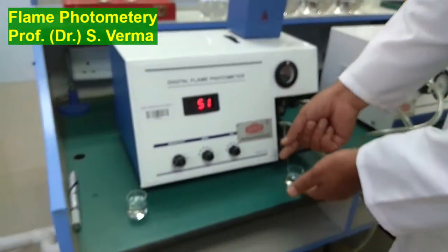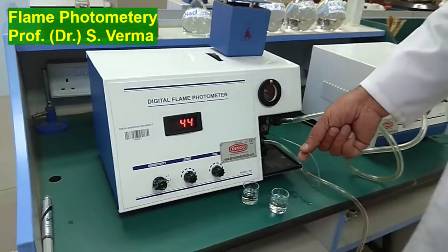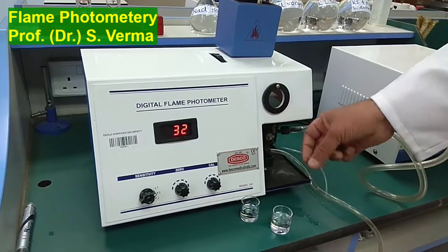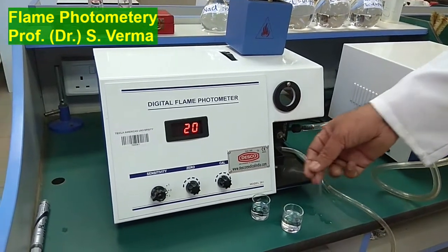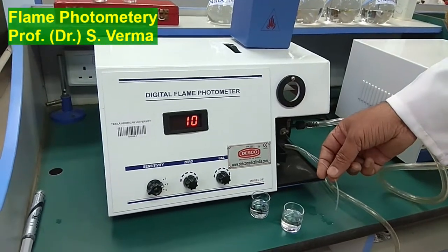Now you take out the capillary and put it back in distilled water. So I'll be putting it back in distilled water. I'm waiting for some time so that whatever solution is there in the tube can go pass through the track.